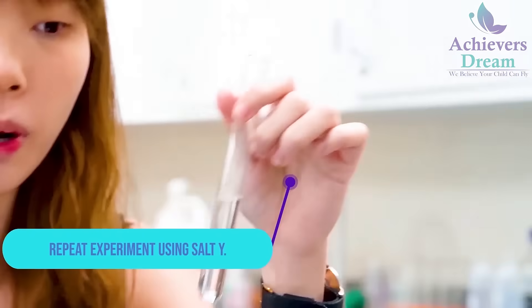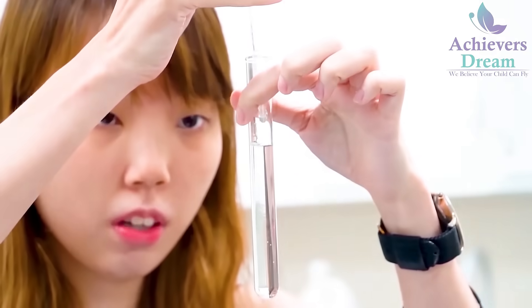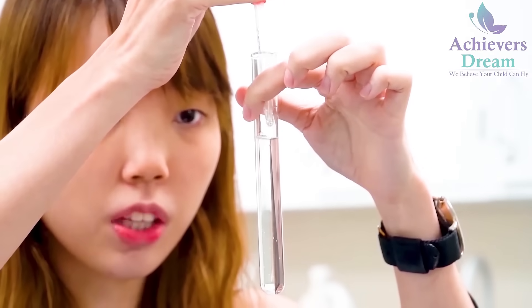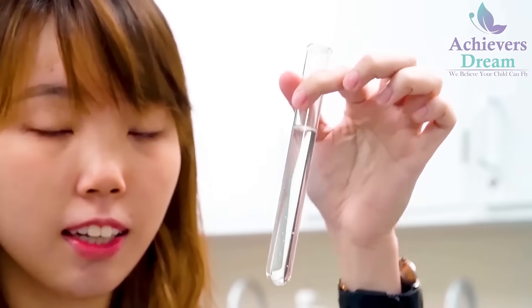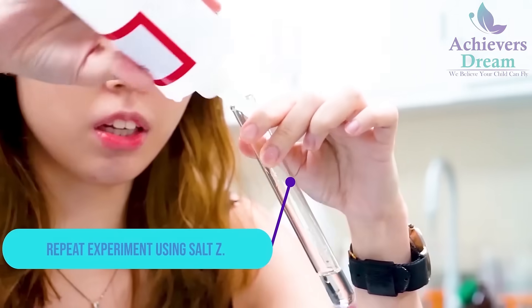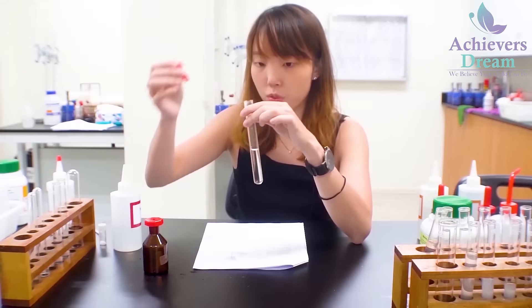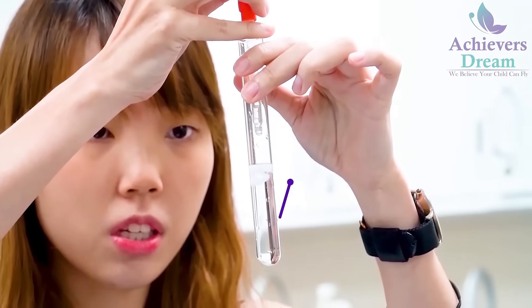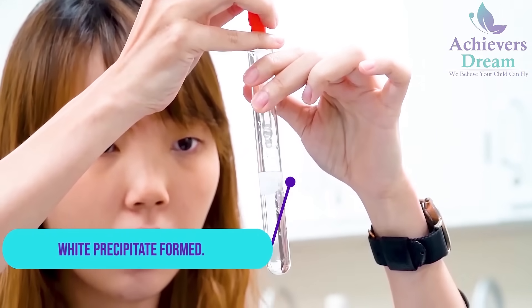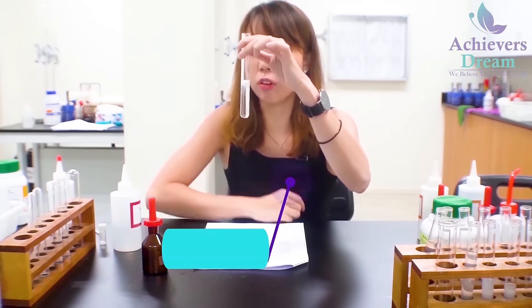I'm going to repeat for salt Y: add nitric acid followed by silver nitrate. Even after addition of silver nitrate, there is no visible change and your solution remains colourless. I'm going to repeat for salt Z: add in nitric acid followed by silver nitrate. Upon addition of silver nitrate, you'll see that there is a white precipitate, which indicates the presence of chloride ions.